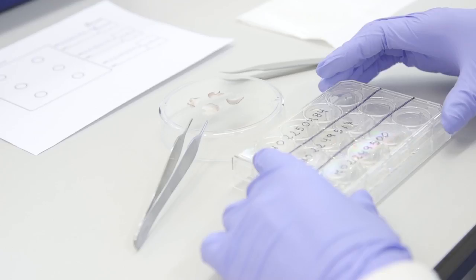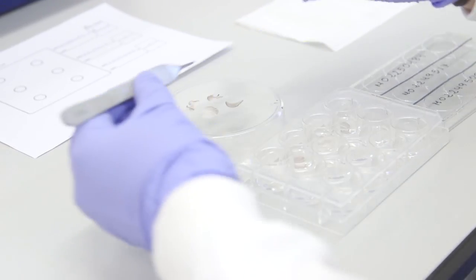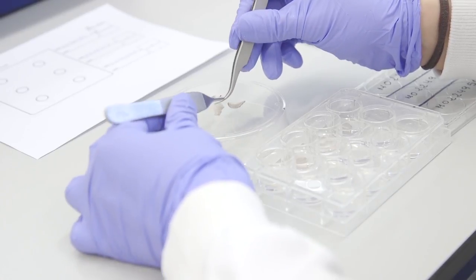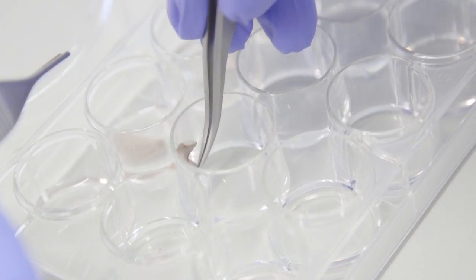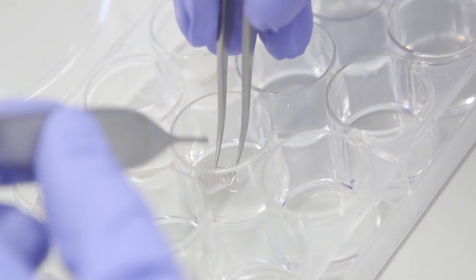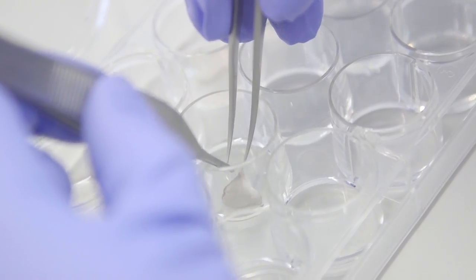Carefully transfer each half into the plate containing ammonium thiocyanate in the row that was labeled with that sample ID. The inner dermis side that appears wet should be facing down and touching the liquid. The ear halves should float on the surface of the ammonium thiocyanate.